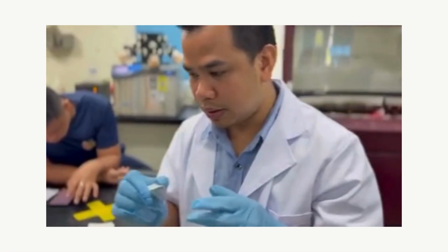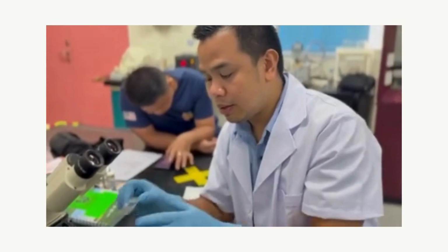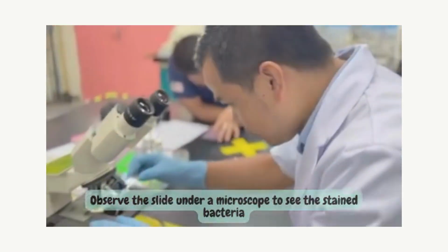Okay, the slide is now dry. Then we place it under the microscope to see the bacteria. Observe the slide under the microscope to see the stained bacteria.